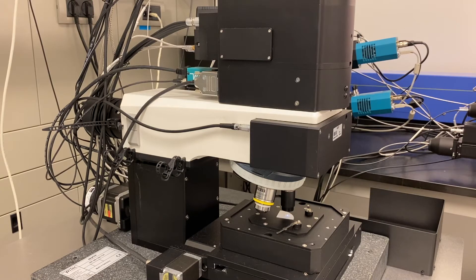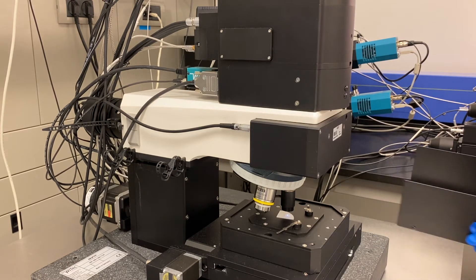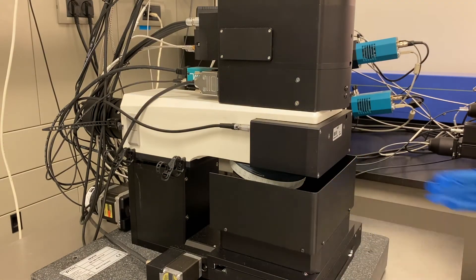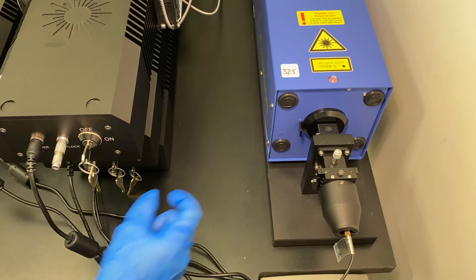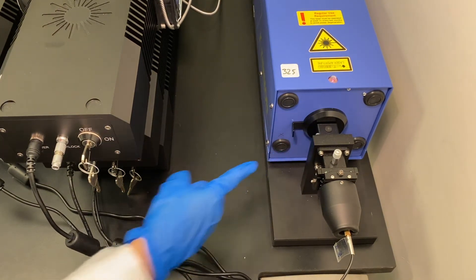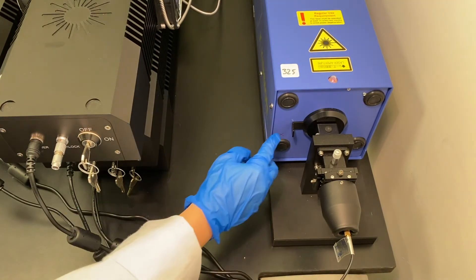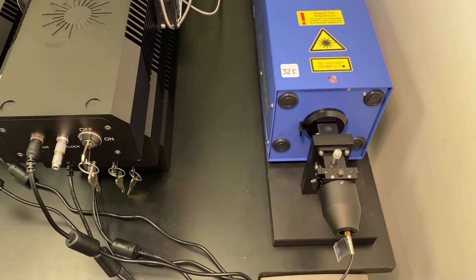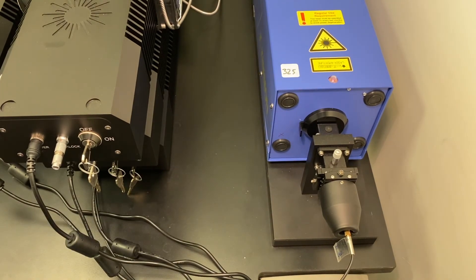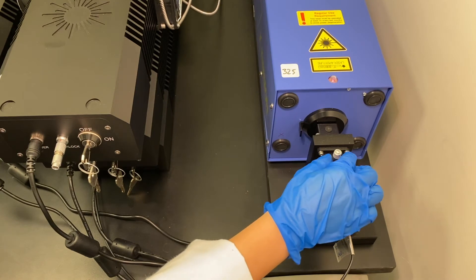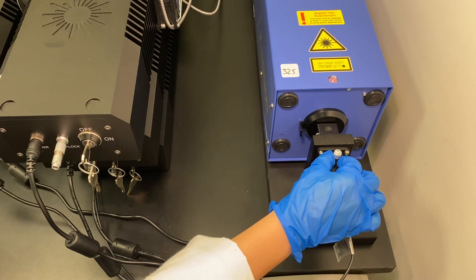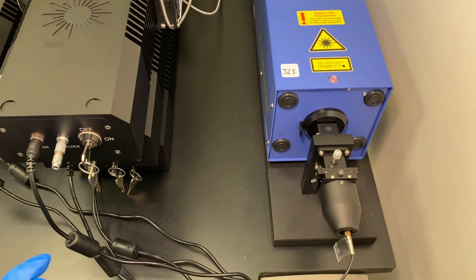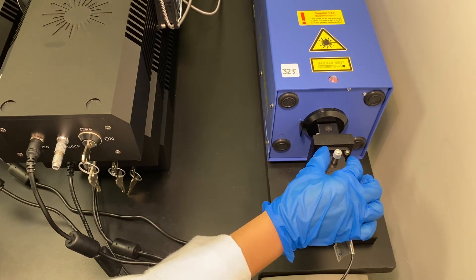Since UV laser is manual you have to put the safety cover back as soon as you finish your focusing. First to operate with the UV laser you have to open the shutter by pulling, and to close the shutter you do the same just by putting in. Also to operate the UV laser you have to manipulate with the slit. The slit knob is this. By turning the knob clockwise you will close the slit for the laser so you will have lower power. If you turn it anti-clockwise you will have higher power of the laser.